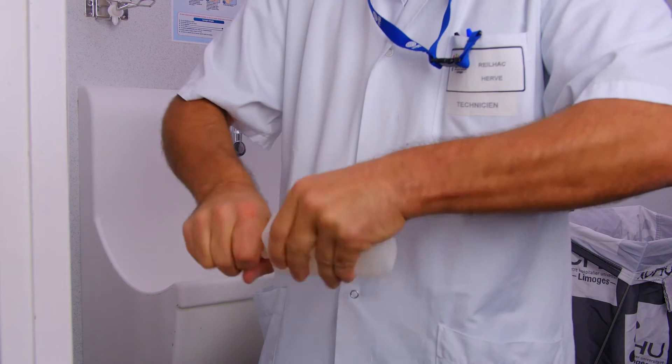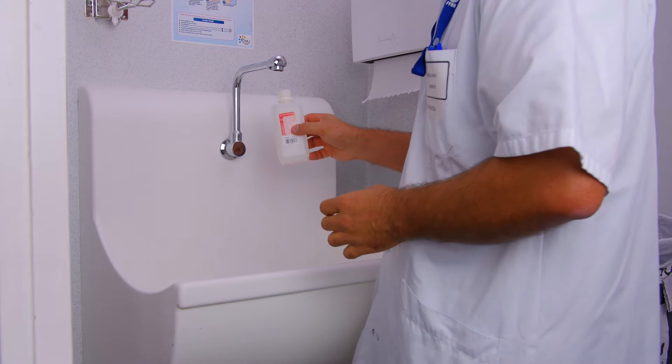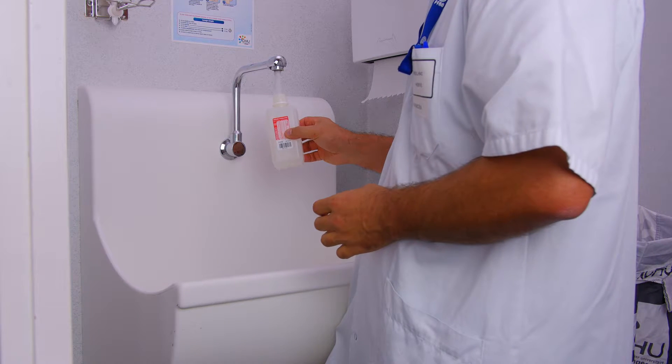Open the bottle and place the lid on the work surface upside down. Place the open bottle under the running water and fill the bottle in aseptic conditions.